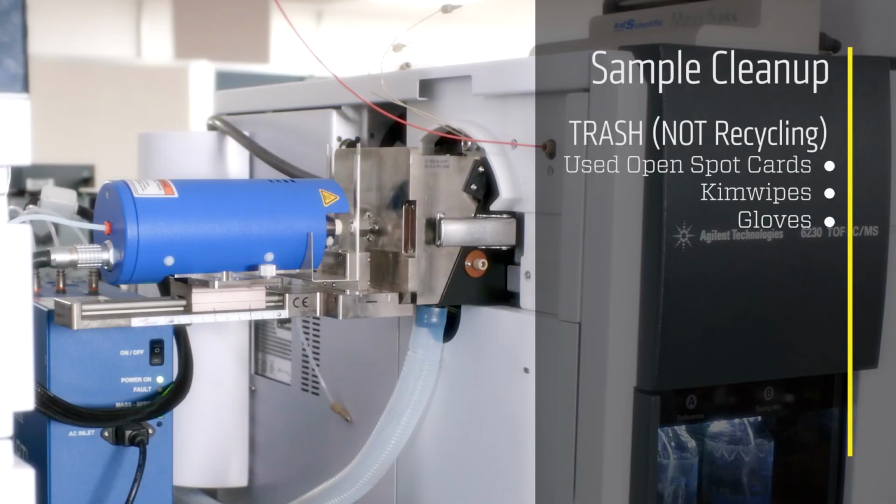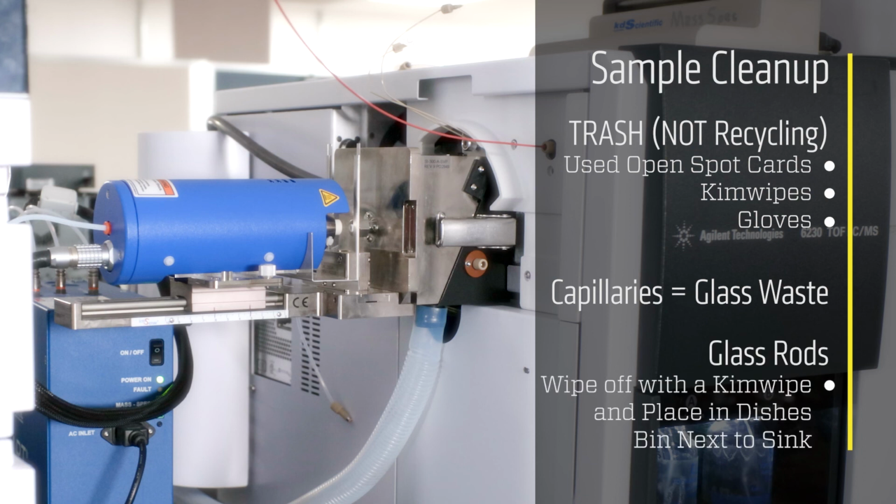Throw away used DART sample cards, gloves, and chem wipes in the trash. Do not put these in the recycling. Used capillaries must go in the glass waste, and wiped off glass rods can go in the dishes bin next to the sink.